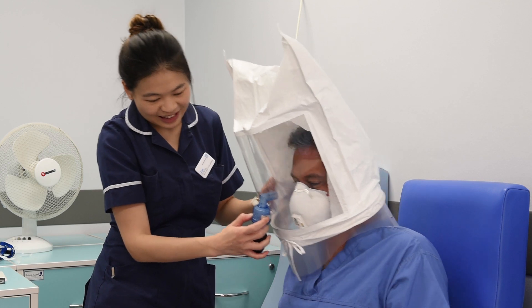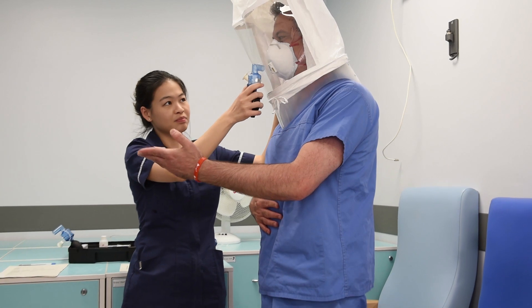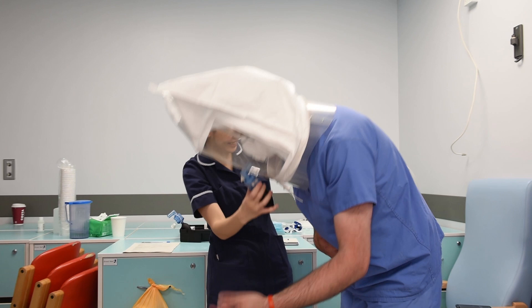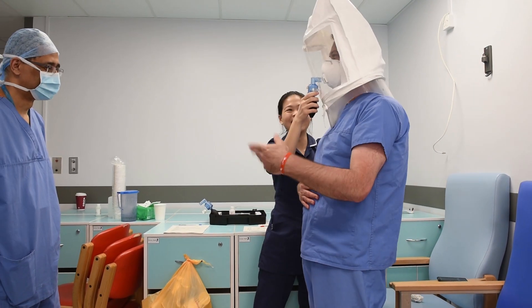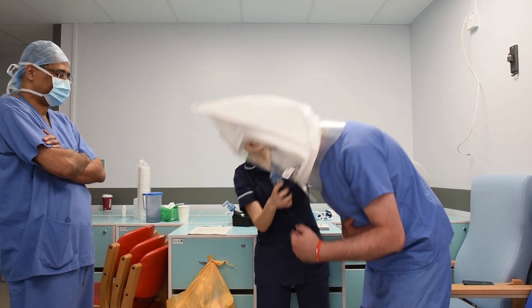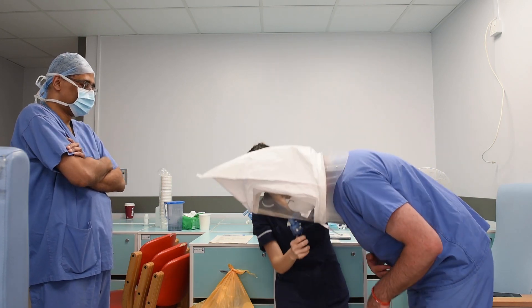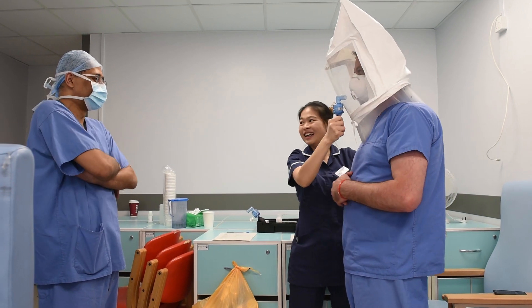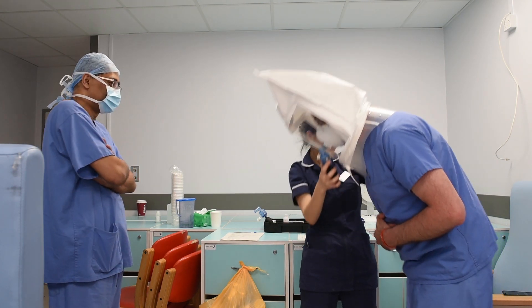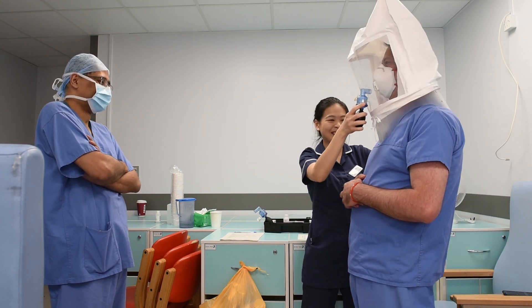Stand up. Now we're going to do a bowing motion — just bow. Bow to my master! We're going to do this for a whole minute. He loves it! I bow even more — but it's good exercise for me too. Bowing to Dr. Malik! Don't go too far, it's all about range. Dr. Malik, you're a hero!